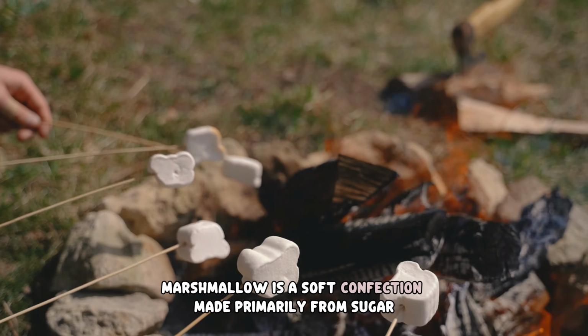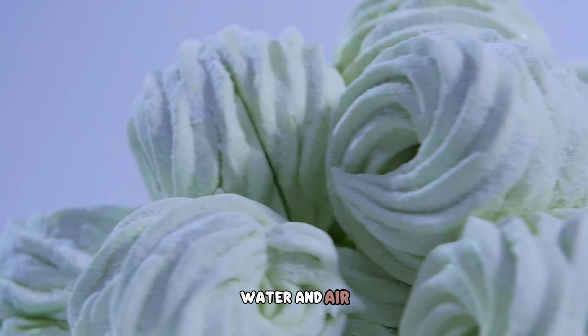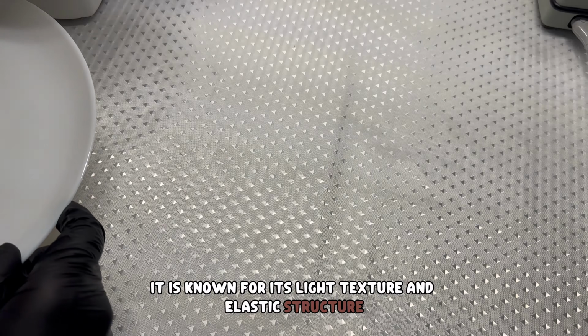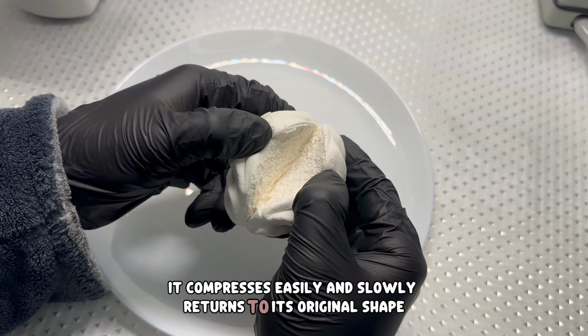Marshmallow is a soft confection made primarily from sugar, water, and air. It is known for its light texture and elastic structure. When pressed, it compresses easily and slowly returns to its original shape.